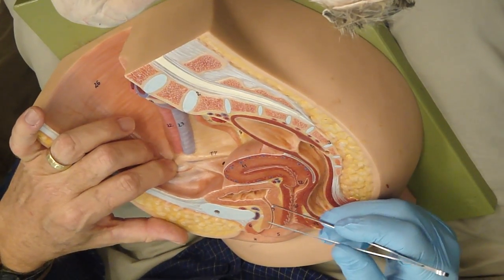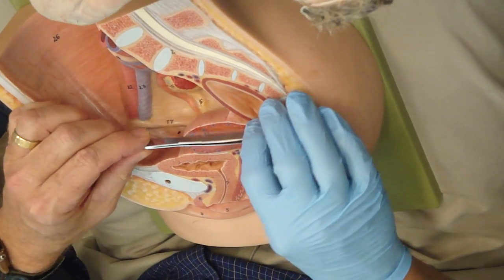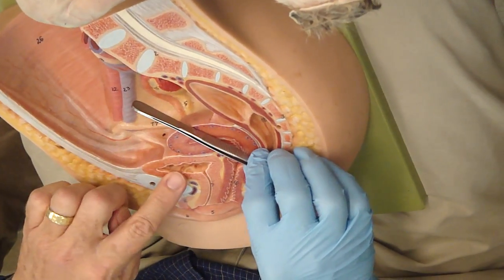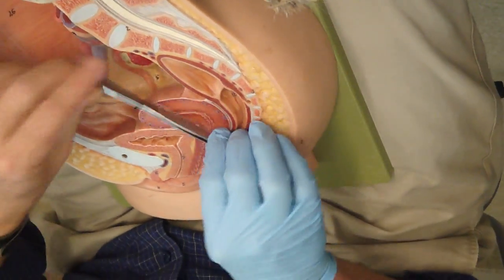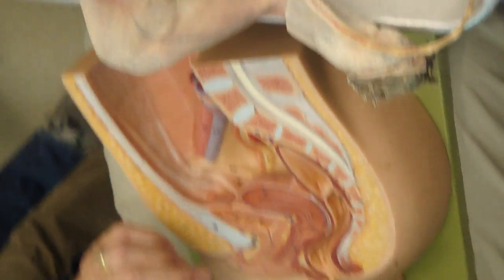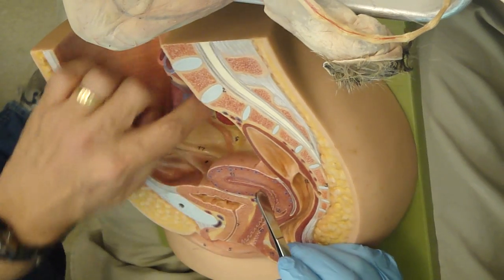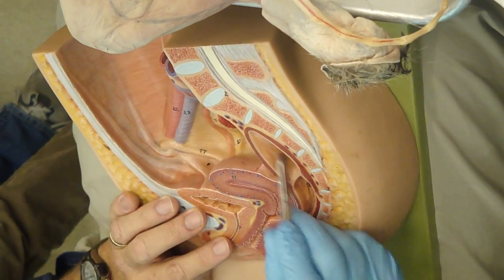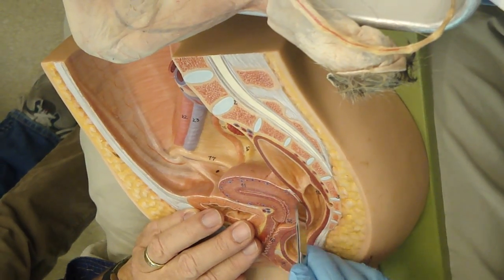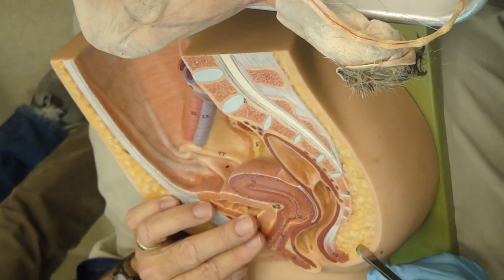Okay? There's another question. Here's the uterus. Notice the anteroflexion of the uterus. The uterus is anteroflexed this way. The position of the uterus will vary, especially depending on how much urine is in the bladder, right? So the question is, what supports the uterus? Well, the uterine support is actually quite complicated and not 100% understood. But apparently it gets its support from the broad ligament here, from some of the suspensory ligaments, from the rectum and the bladder that nestle it right between the two, and from the ligaments that attach the rectum to here, like that. All of that supports the uterus.